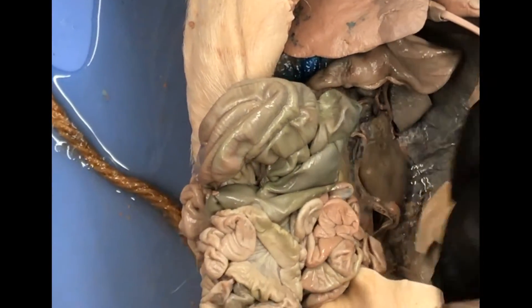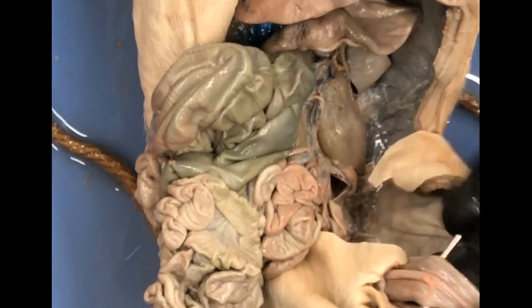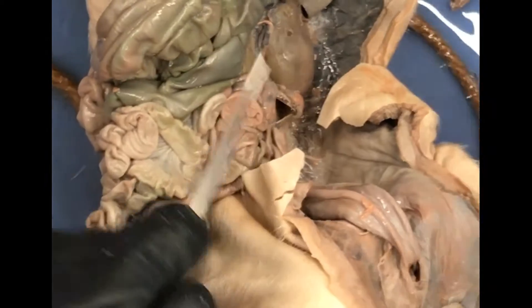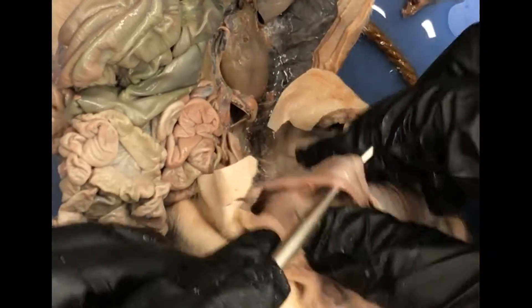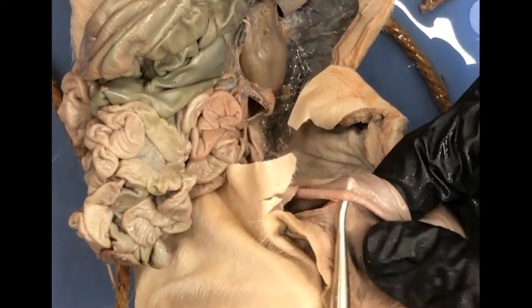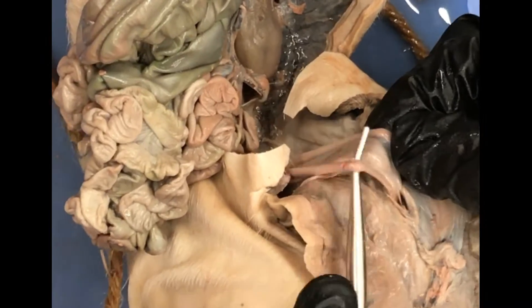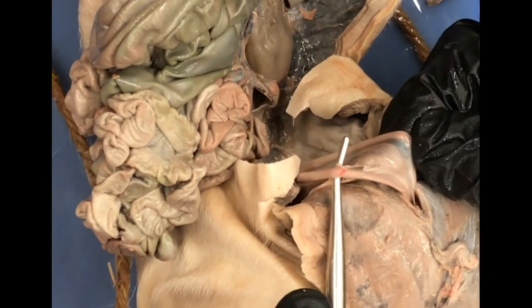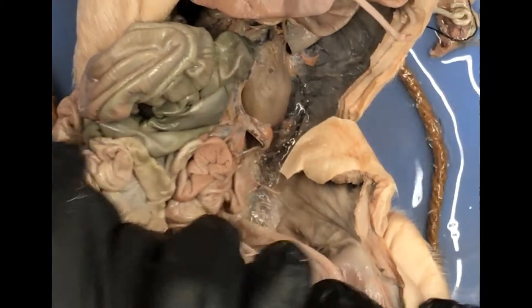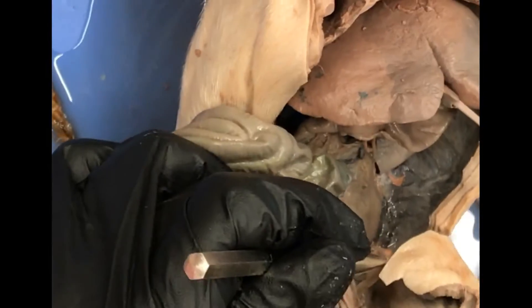The urinary bladder is between the umbilical arteries. These are the umbilical arteries — here's one and I'm holding the other one. Between those is the urinary bladder. The ureter will head right to that.